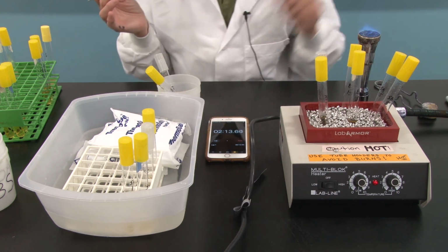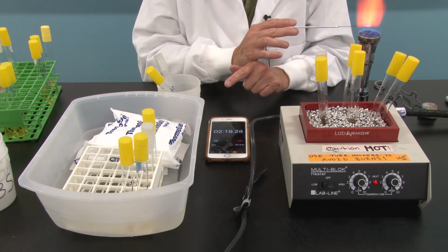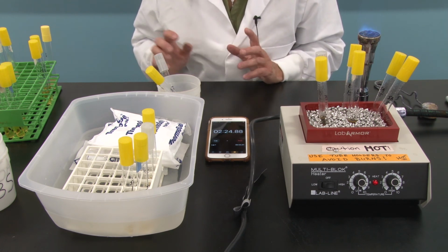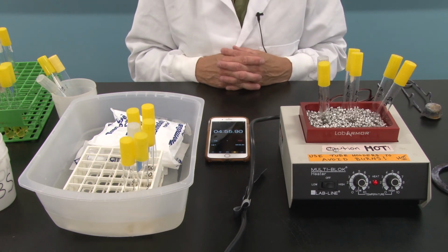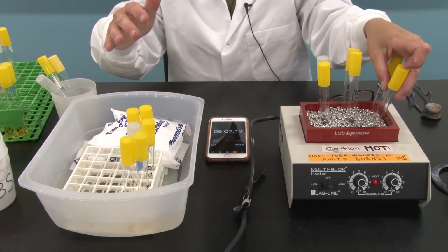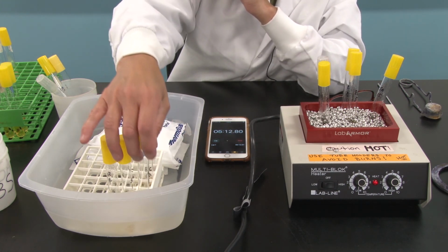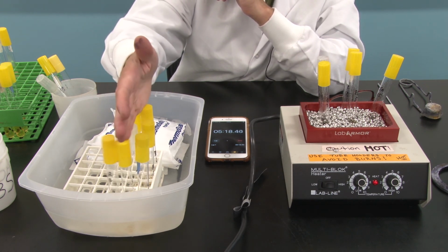Okay? Now, I'm letting this go. I'm going to cut back at 5 minutes and remove the Staph aureus. And I will also inoculate our control Bacillus subtilis and E. coli. Okay, so we're coming up on 5 minutes, and at 5 minutes I'm going to remove the Staph aureus 5 tube and place that on ice. I have gone ahead and placed all of the controls, the SA0, the EC0, and the BS0 in the ice bath. After inoculating those, we have all the 1 minute tubes here.